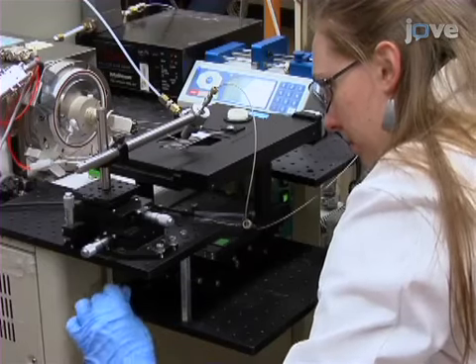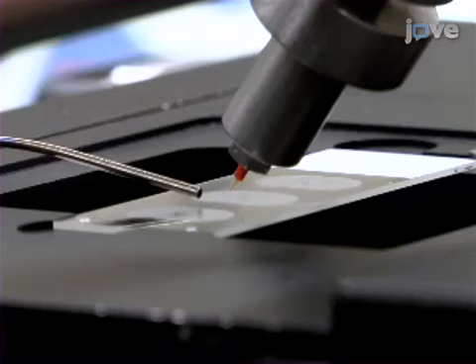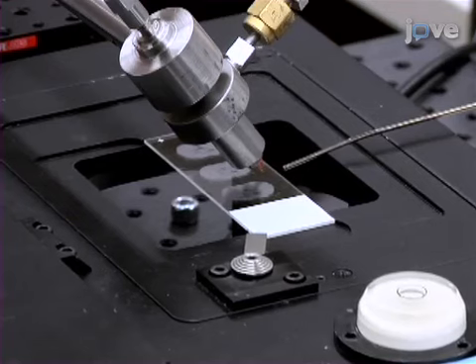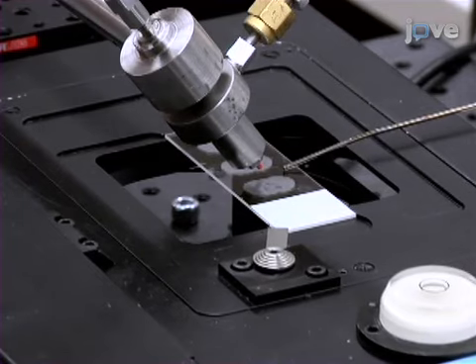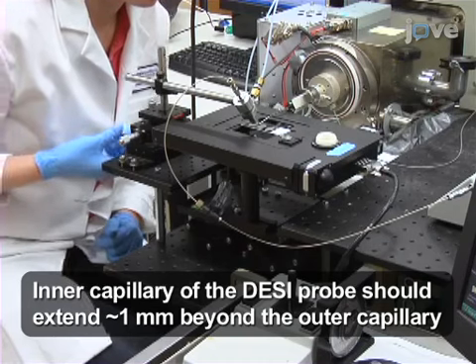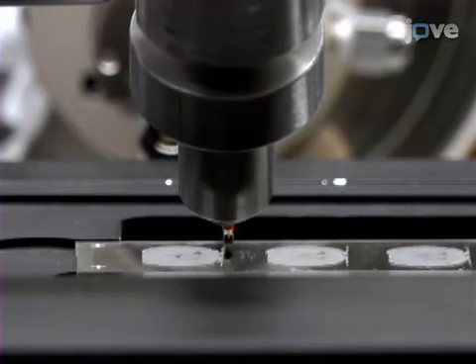For optimal transfer of ions, adjust the stage height so that the MS interface capillary hovers over the sample surface. The capillary should be less than 1 millimeter from the surface and have a collection angle of about 15 degrees. Once the slide has been mounted on the motion stage, position the tip 3 millimeters from the sample surface and 5 millimeters from the MS capillary inlet, with the probe at an angle of 55 degrees with respect to the sample surface. Next, align the DESI probe in the X dimension with respect to the MS capillary inlet so that they are directly in line.